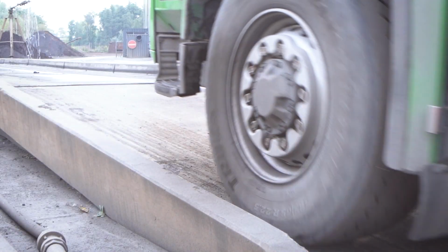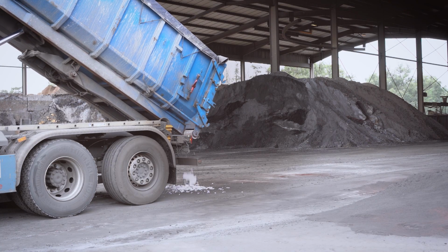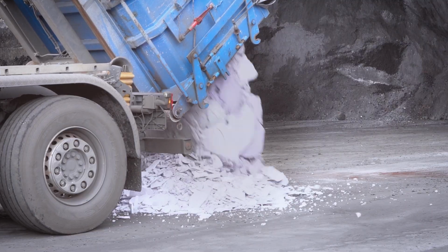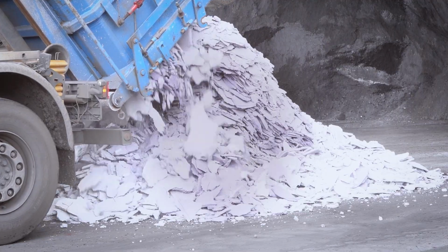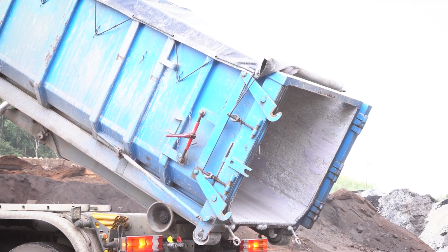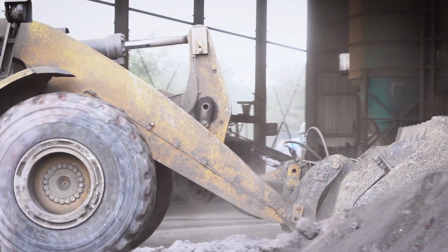Waste analysis is essential to classify waste for further use. Therefore, mainly heavy metals as well as TOC, DOC, and halogen parameters are determined. This video gives an impression from sampling to the result, illustrated by the example of a waste treatment company.